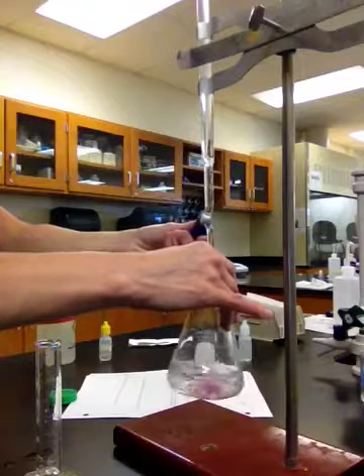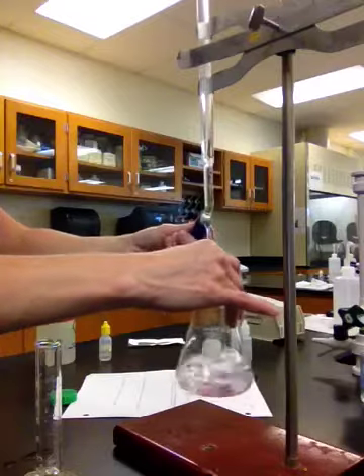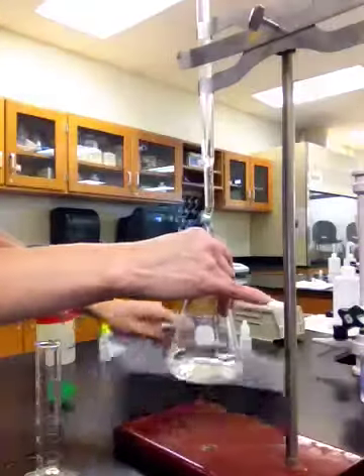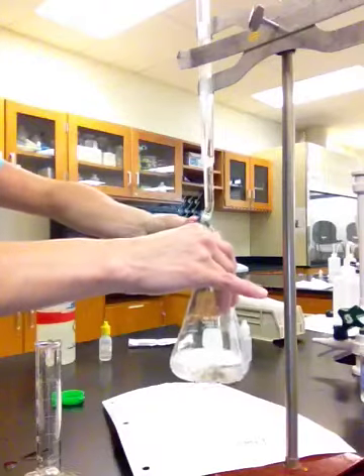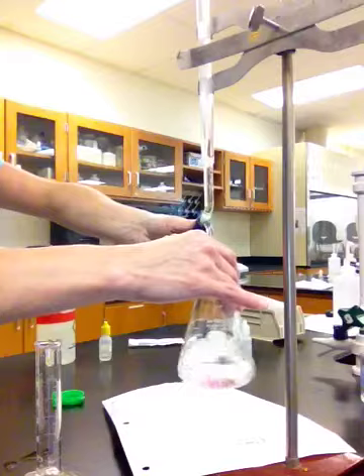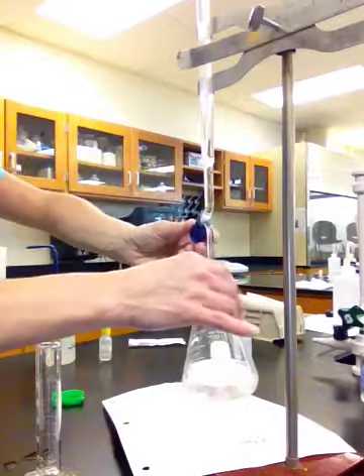Keep going, keep going. I'm sorry you guys have to watch this. I know this is not a very professional video. Okay, we're getting kind of close here. Sticking around. That pink color is just not disappearing as fast, so I'm slowing down.